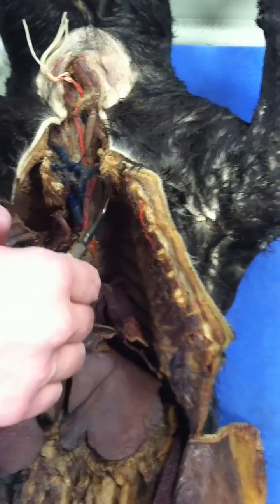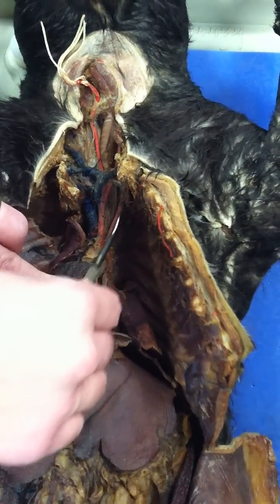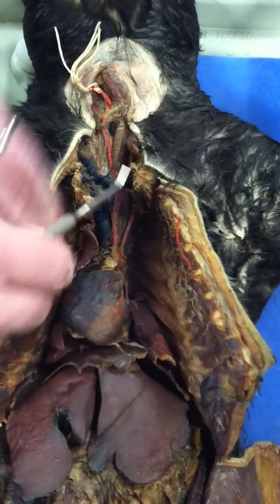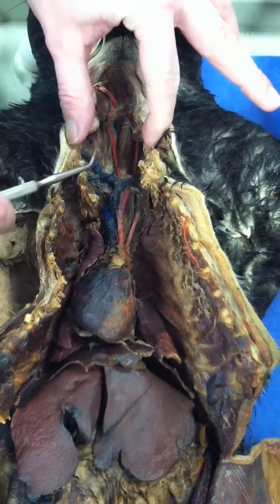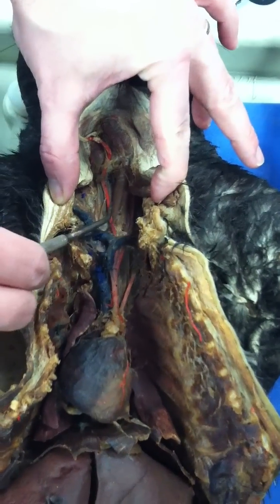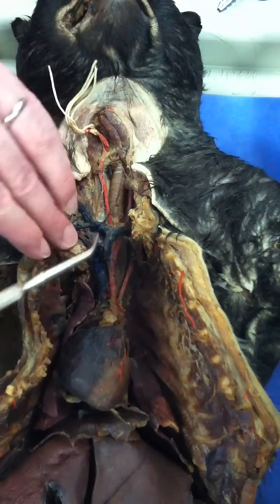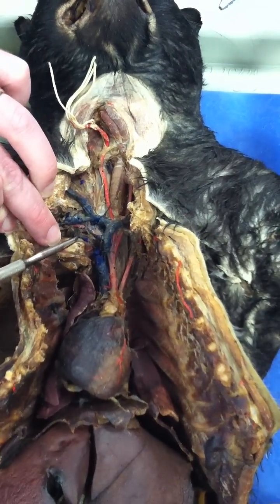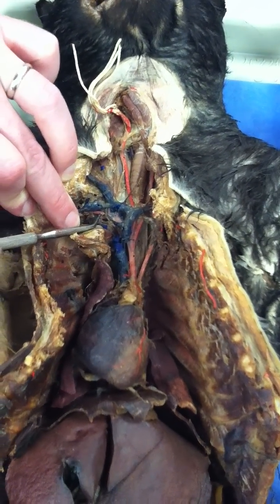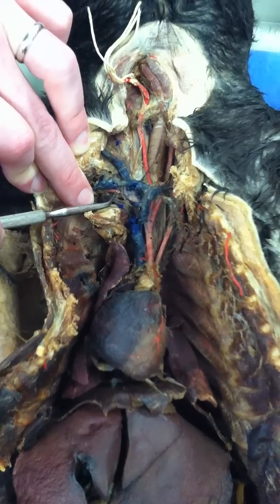We can see the subclavian artery coming off of the heart here and the brachiocephalic artery coming up. If we get up in the neck region, we can nicely see the two carotid arteries on either side of the trachea, and with a little manipulation we can make out the subclavian artery coming over to the right arm right there.